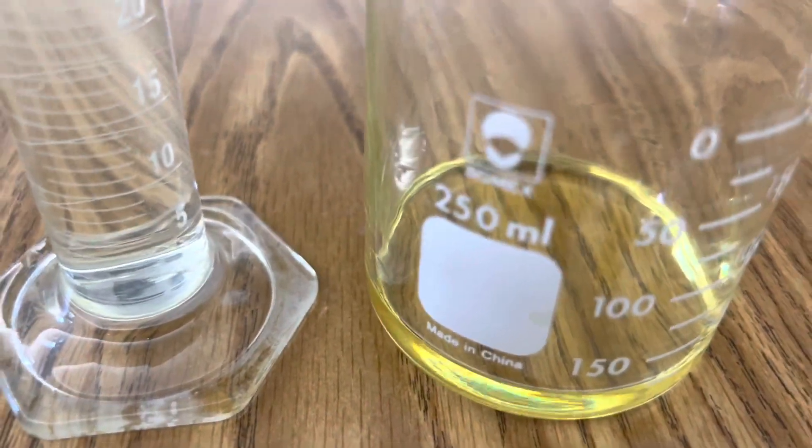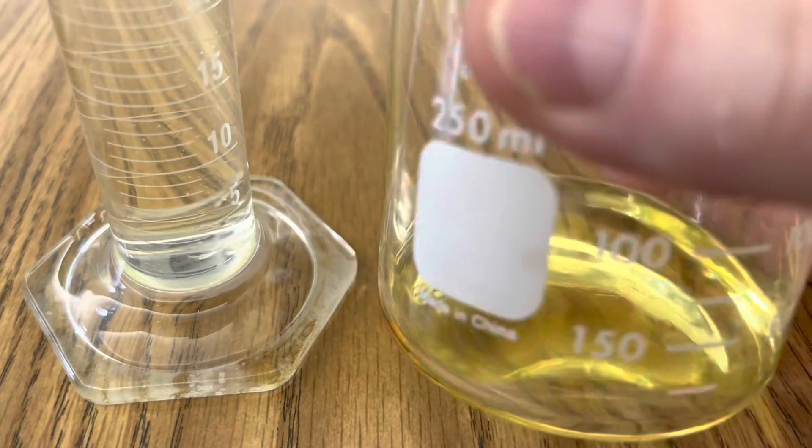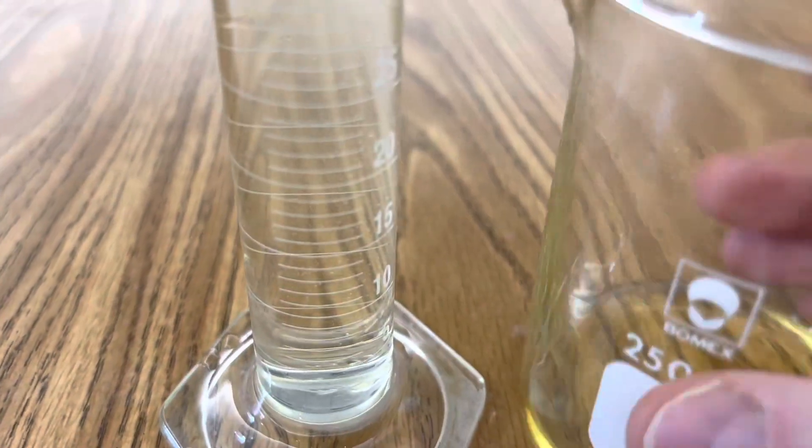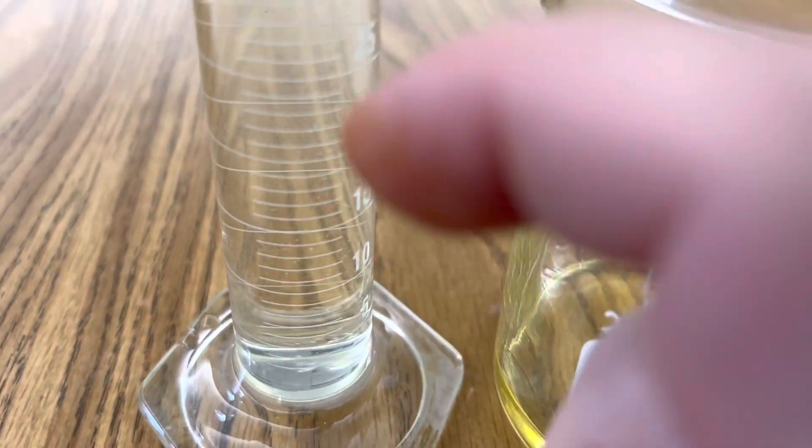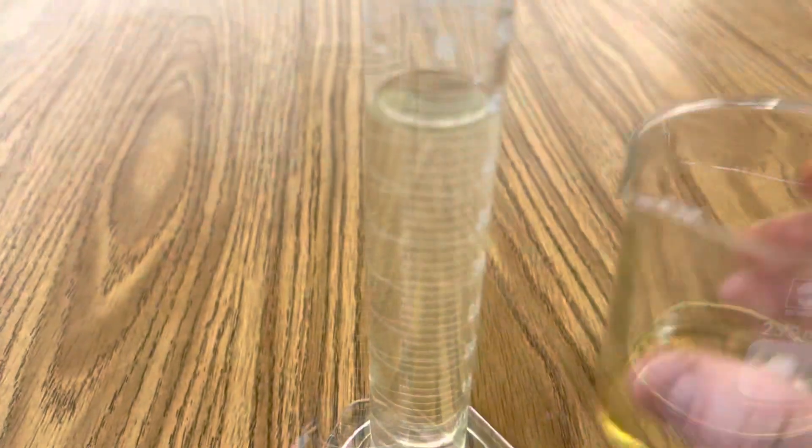Okay at this point you can see that all of our mercury is dissolved in our nitric acid making mercuric nitrate and our aqueous solution of potassium iodide is ready. This is the double displacement reaction which will create an insoluble precipitant mercury iodide. Check this out.